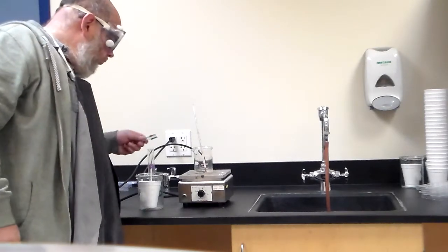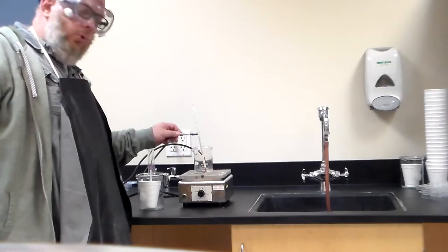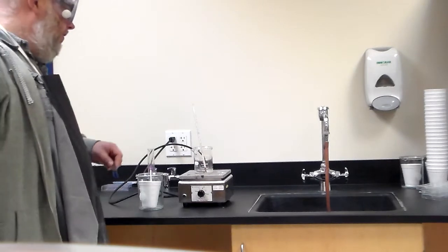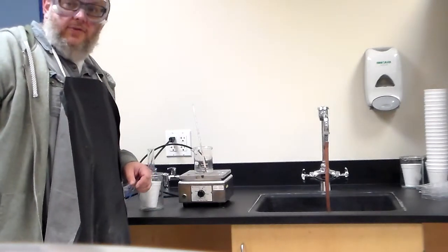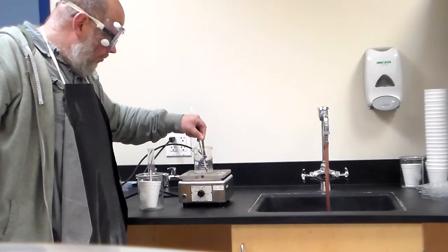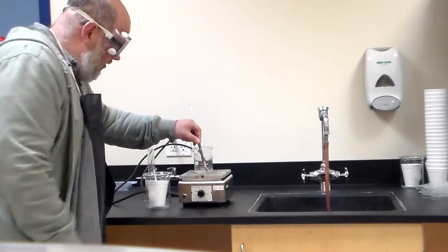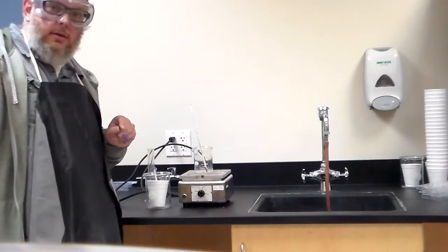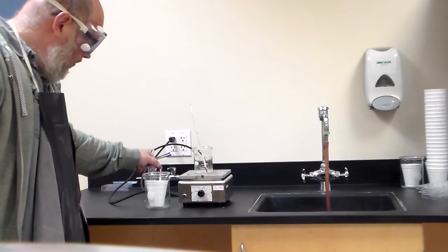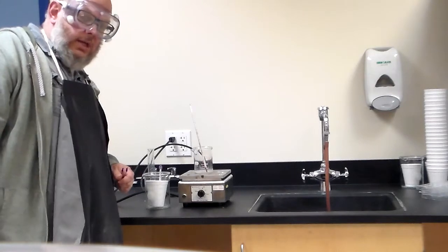Next thing, once you're ready to go, and this has been boiling for a while, and it's a nice hot temperature, then you have to go in, and this is the next trick, and I'll probably have to give you guys some kind of special hooks for it, where you're going to be picking it up. You're going to take that. This has got to be fast, guys. It has to be fast. You're going to take this and put it in immediately, and then you're going to watch the temperature change on this thermometer here. Now, if necessary, we can switch thermometers. That's not a big deal.